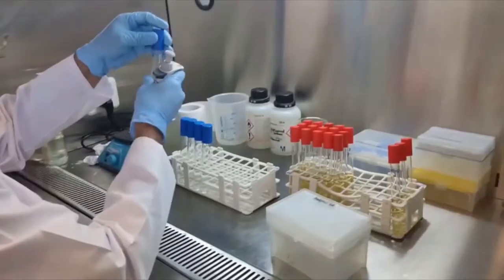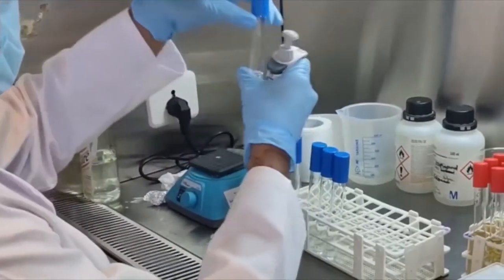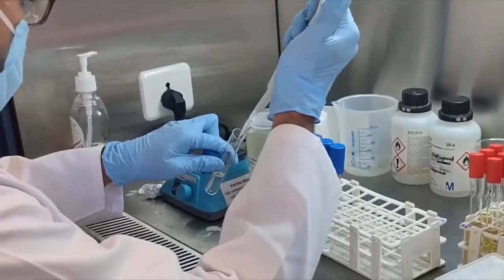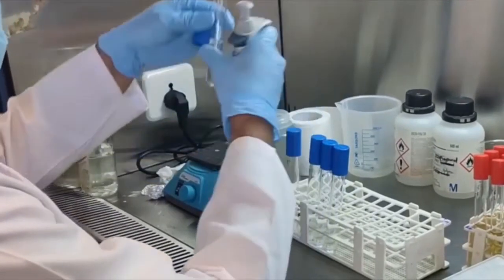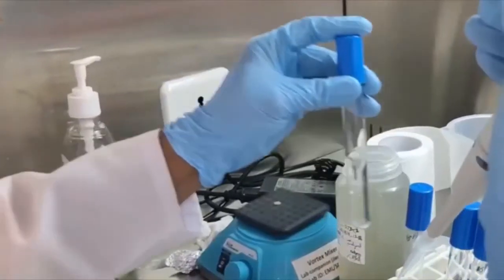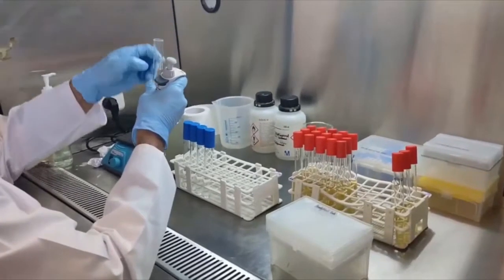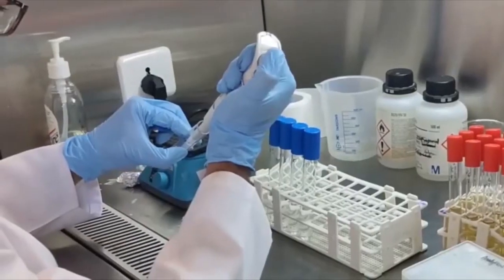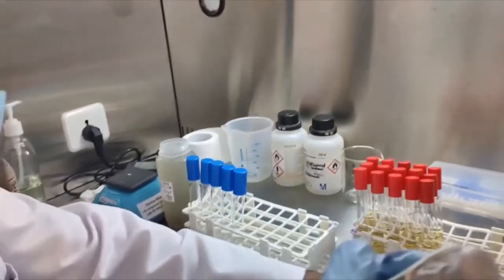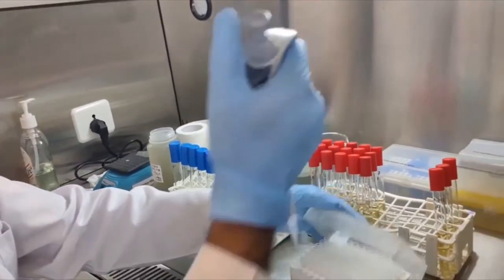With a new tip, take 1 ml from this tube and add it into a 9 ml sterile normal saline tube. This is the 10⁻² dilution. Continue the serial dilution procedure up to 10⁻⁵ or more depending on the sample type. Separate tips should be used for each step to avoid carry-over of sample to higher dilutions.